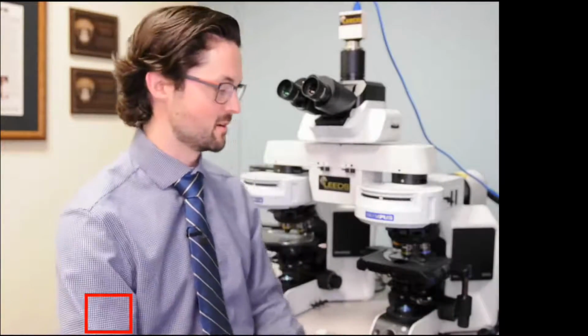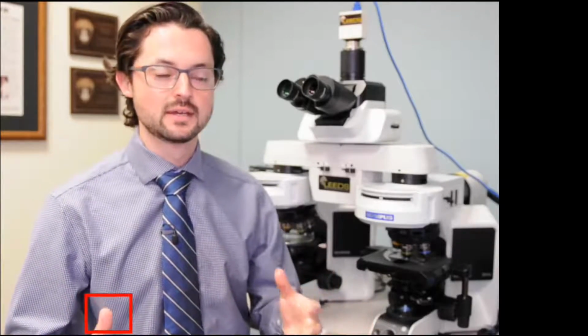Following up from last week's live stream, this week's live stream is also going to be on our trace comparison microscope systems, specifically the LCT system behind me. And today's helpful tip is going over probably one of the biggest things you can do for a polarizing light microscope, which is objective and stage centration. It's kind of an art form, getting it just exactly perfect. Hopefully this will help you as you're using it in casework, getting things lined up, that kind of thing.